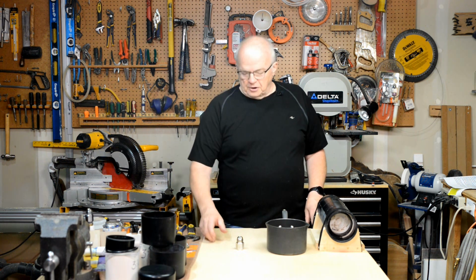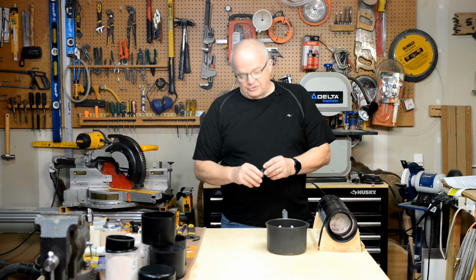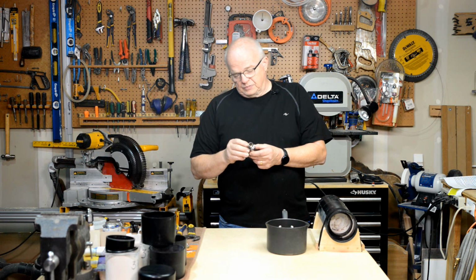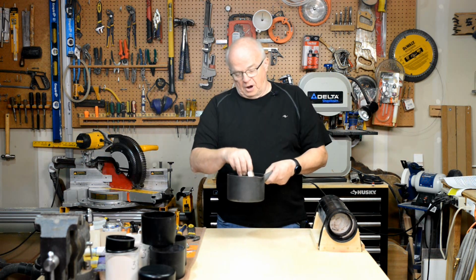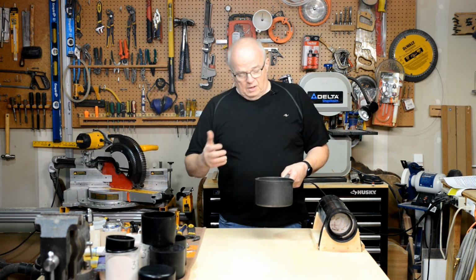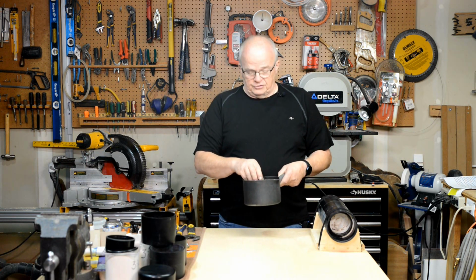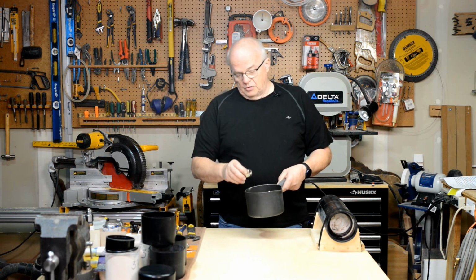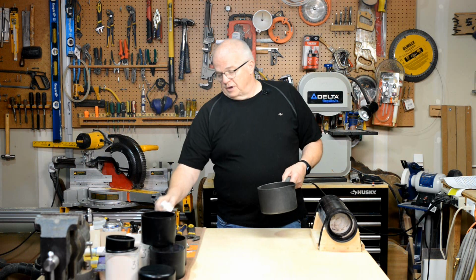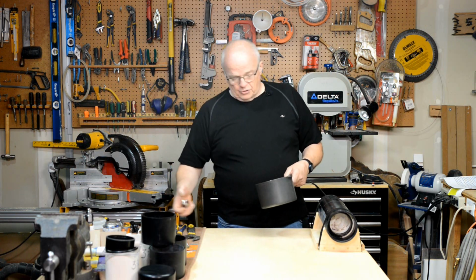Okay, so let's get started. The first thing I want you to do is take these 2 metal pieces, these vacuum adapters, and put them in a pot. Fill it with water, and put it on the stove and get it to boiling. That has nothing to do with sterilization, but it does have everything to do with the physics of what happens to this when it gets hot and how it'll act when you screw this into it. So go ahead and do that.